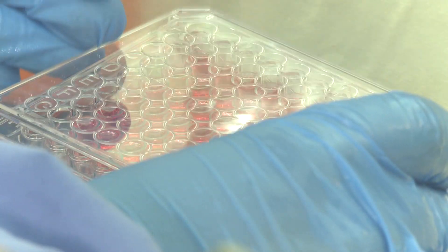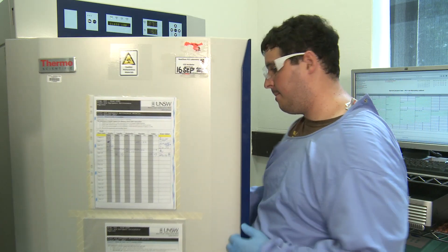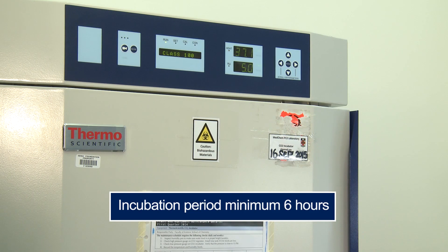Remember to include zero wells which will not contain any treatment. Leave these cells to adhere in an incubator for a minimum of six hours.